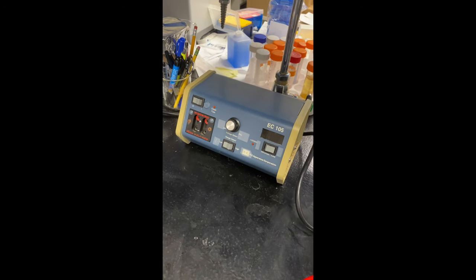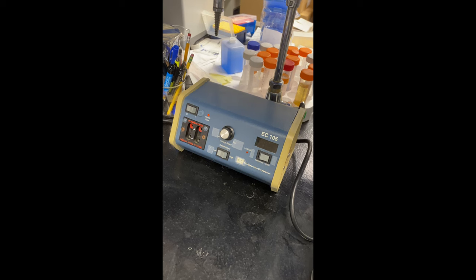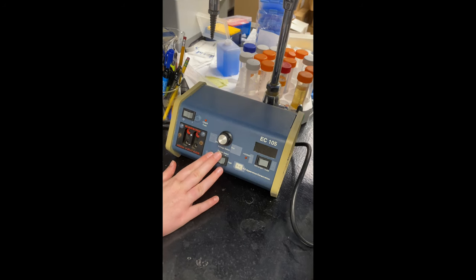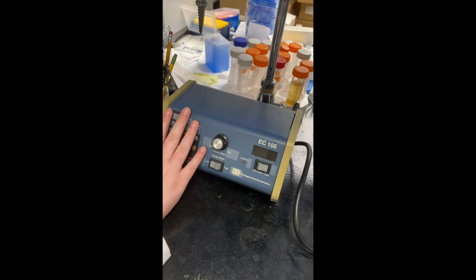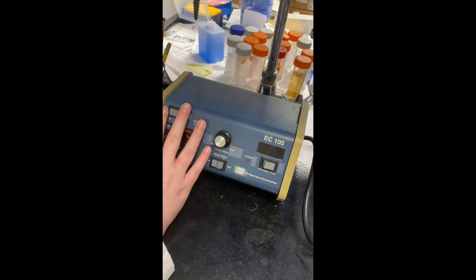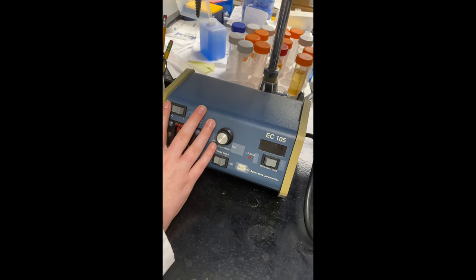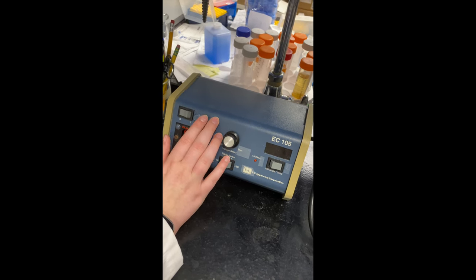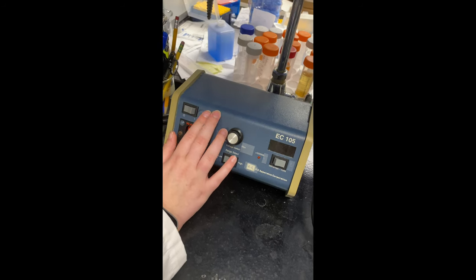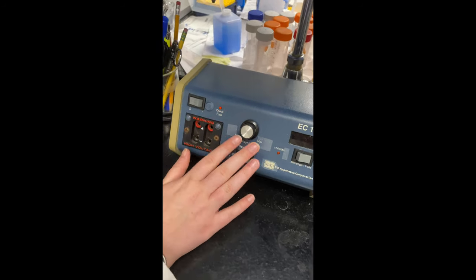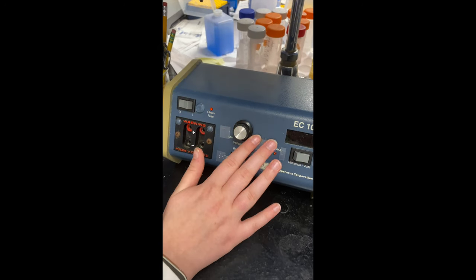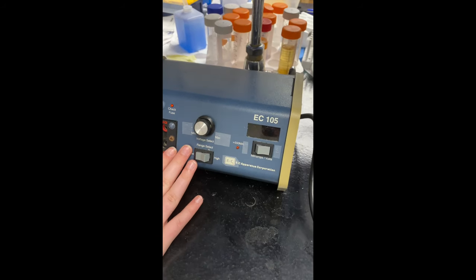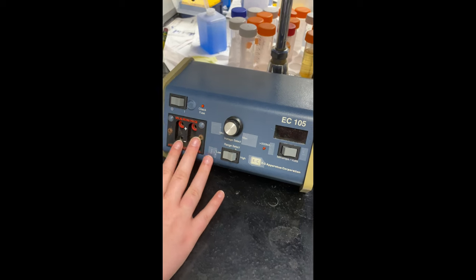Would you like me to take you from here? Yeah, all righty. So first thing you got to do is power on the machine. To turn it on there is a side of the switch that has a bump dot and the other side doesn't. So if your switch is pointing towards the side with the bump dot, you know it's on. We have min and max for minimum and maximum label on the dial.